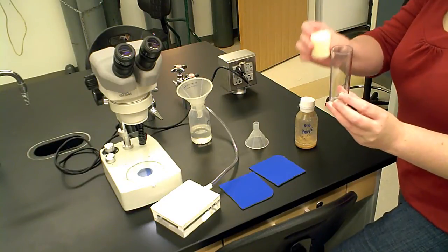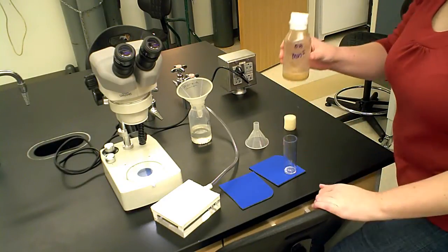Here is your holding vial and top. Here is the bottle of flies.